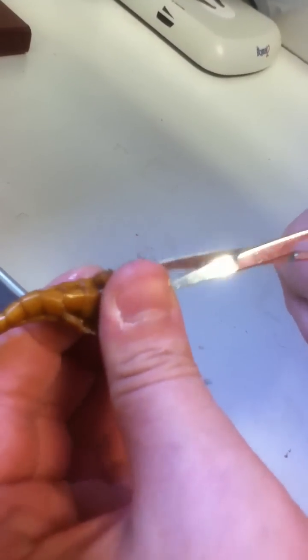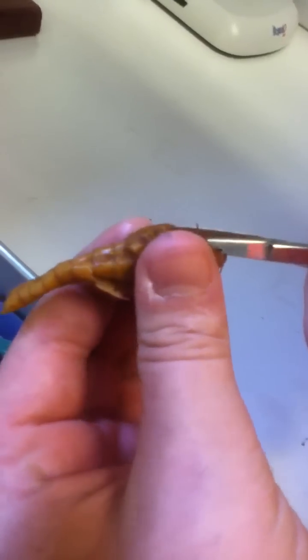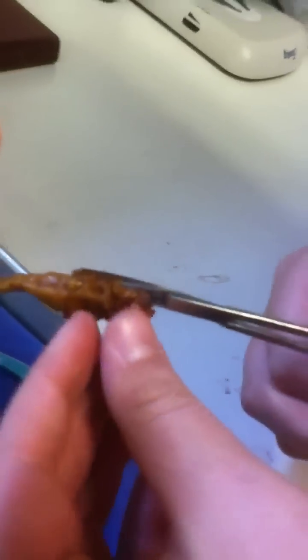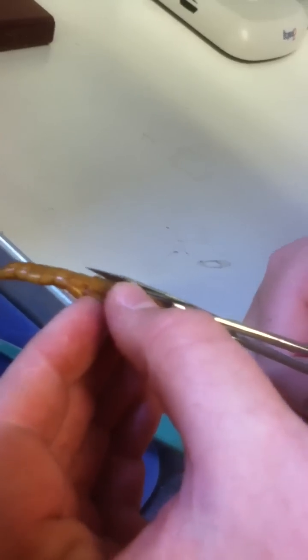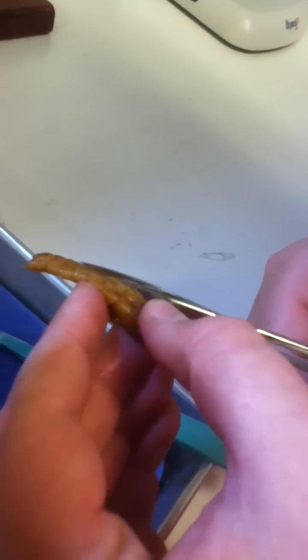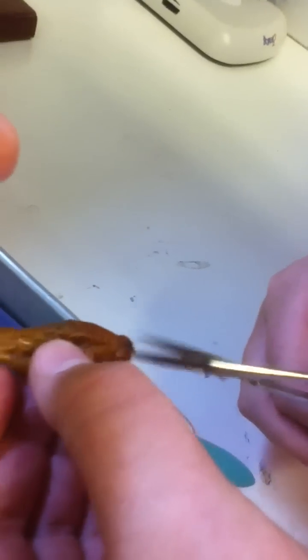Well, then look at me destroy you. I think you cut the wrong part. I just cut his eyes open. Okay, that's wrong. I know, you cut it right through its eye. That would be funny — he actually comes back to life. Andy sent this to me today. I'm gonna show my mom. She could probably freak out.